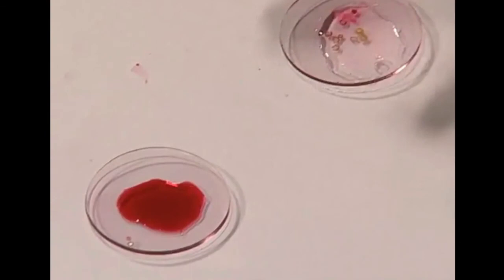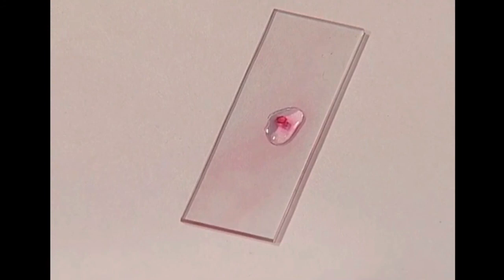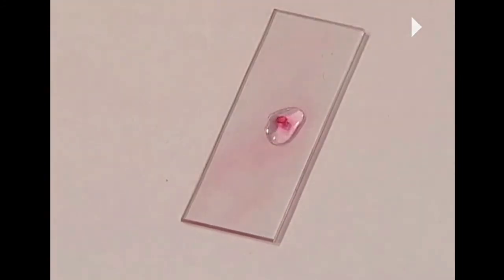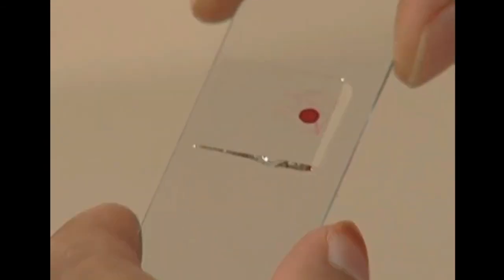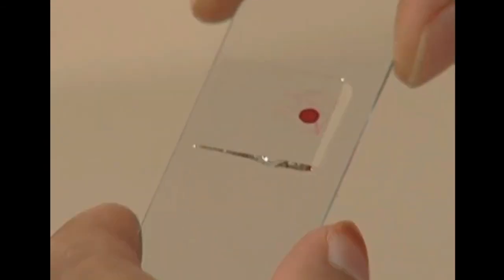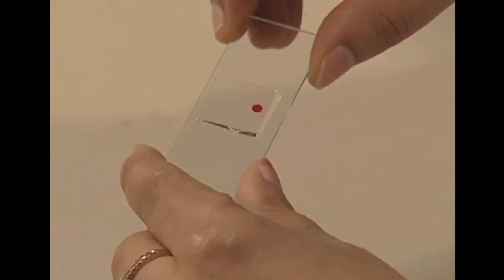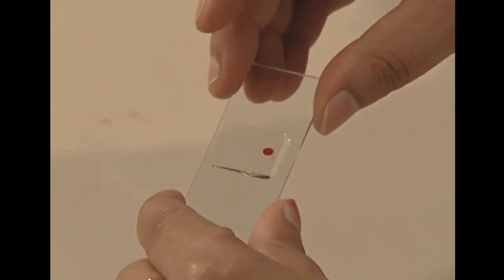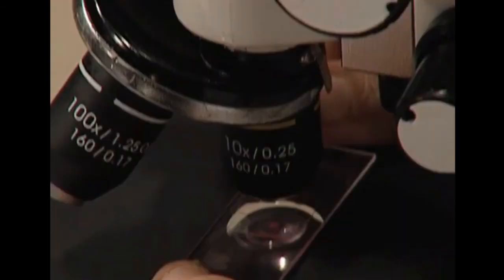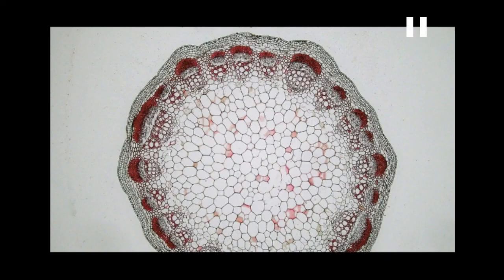The thin slices are now ready to be observed under the microscope. Transfer them onto a slide, place a drop of water using a brush, and carefully place a cover slip on the specimen. You can also add glycerin to keep the section from drying for some time. Mount this slide on the stage of the microscope and focus it under the low power objective and then the high power objective.